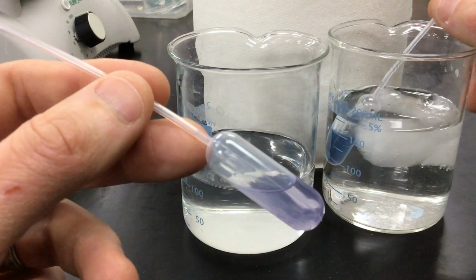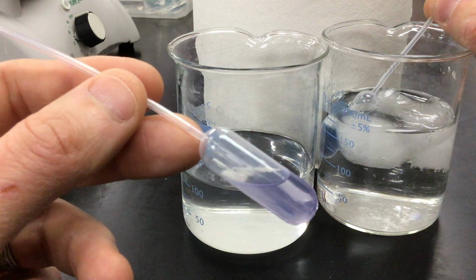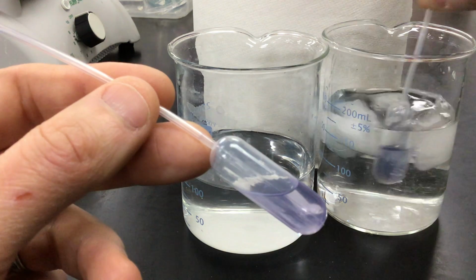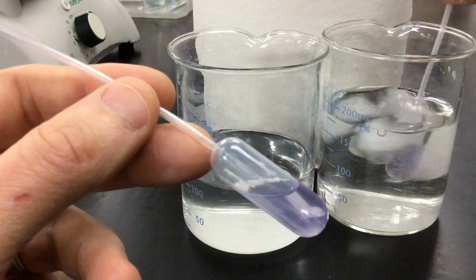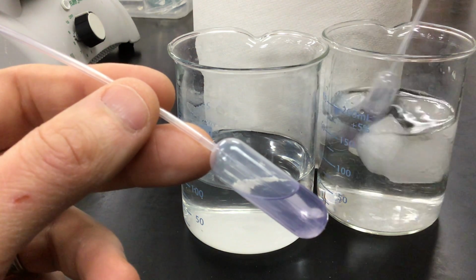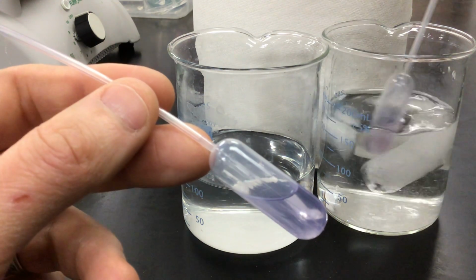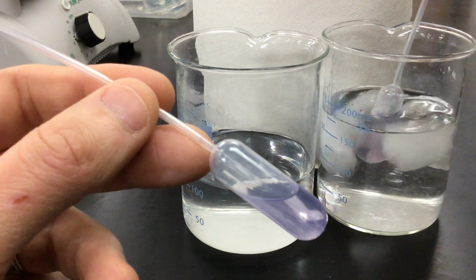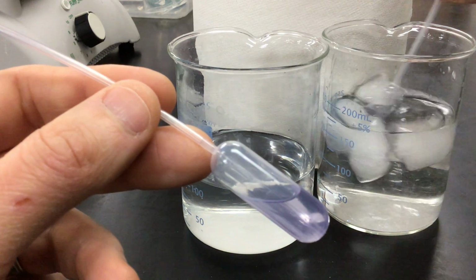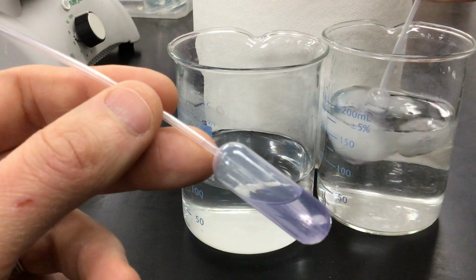Now we're going to place that pipette into an ice bath, which contains cold ice water. I'm going to let this sit here, and this might take up to a minute. But you can clearly see we are starting to see more and more of a color change with the addition of the cold water. Because the sealed pipette is inside of the ice bath, thermal energy is being pulled from it, and we should now see it change to a different color.